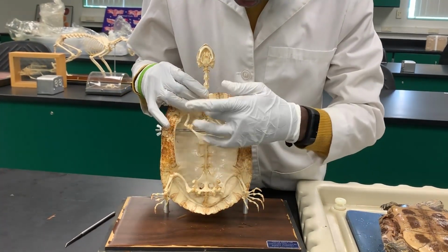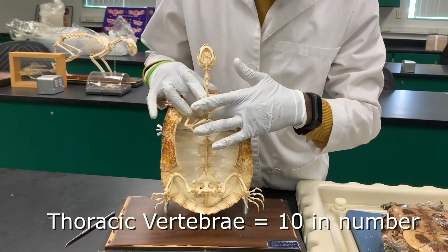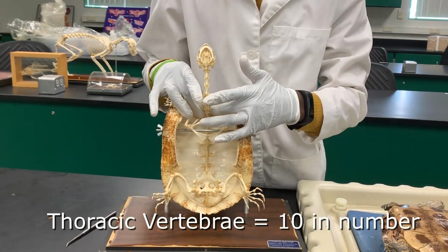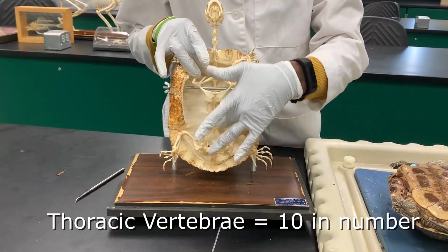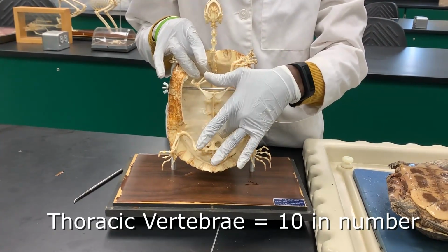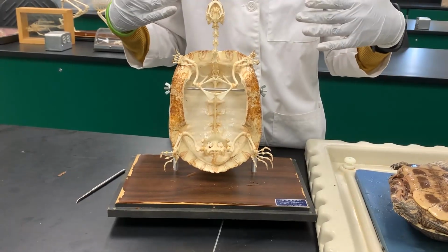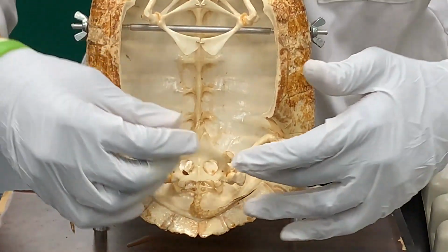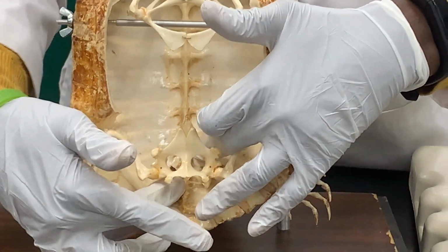Then we have 10 thoracic vertebrae, which run from the base of the neck towards the abdominal area, and they have the ribs attached to them. Towards the pelvic area, you have the sacral vertebrae.